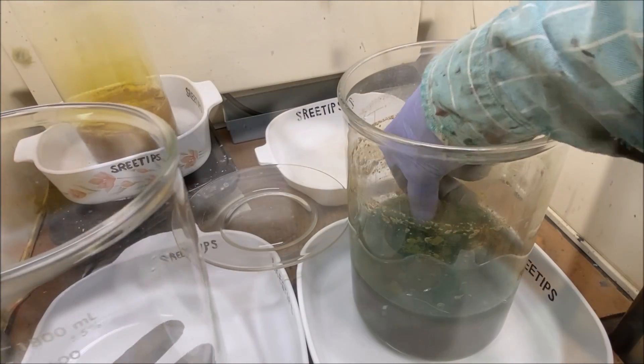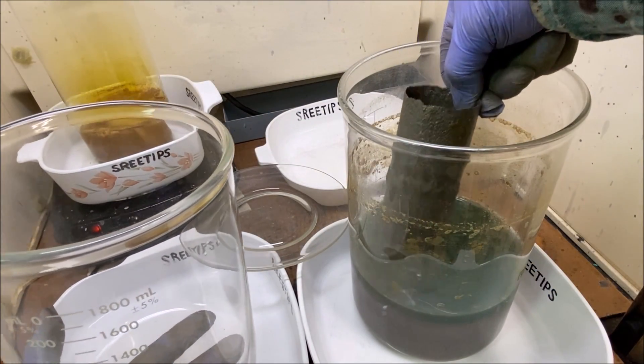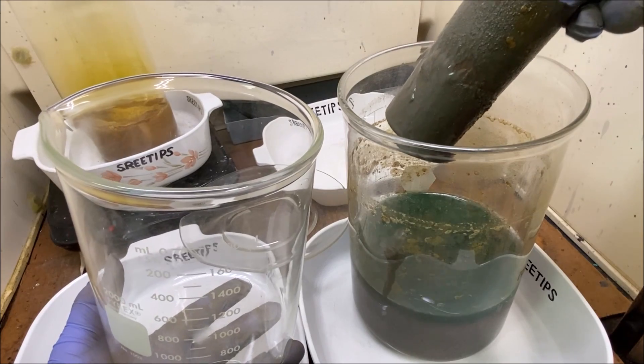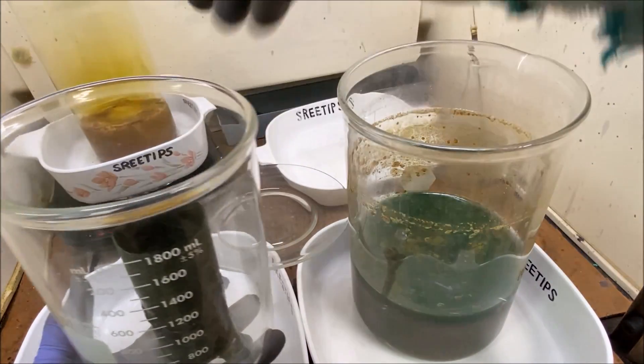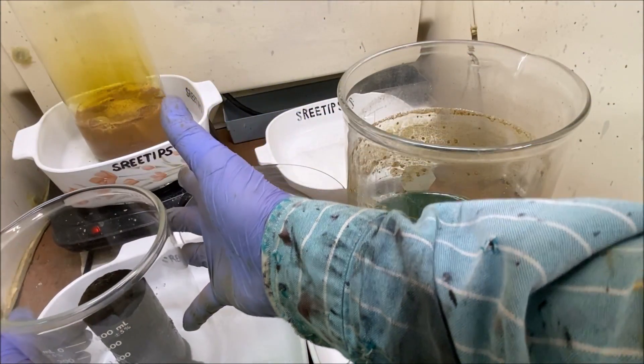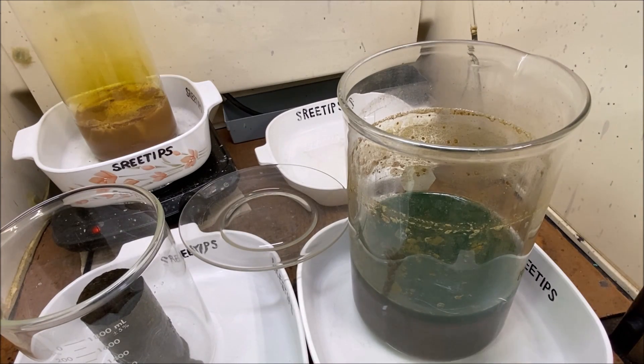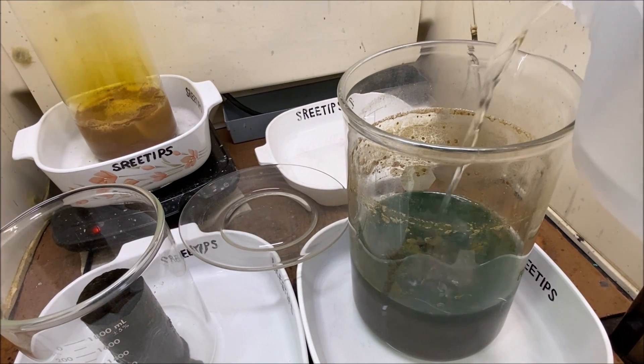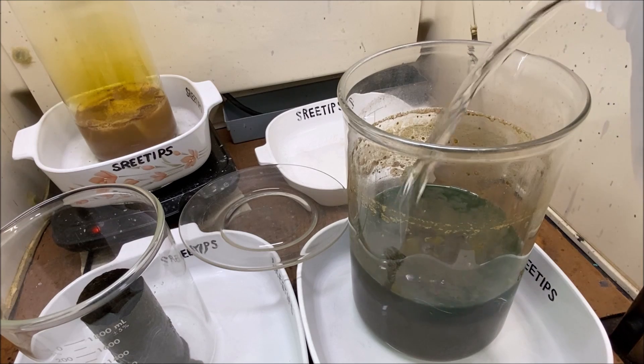Let's get this piece of copper out of here. It's still got some metallic copper left. I'll use it cementing out silver in another solution. But for right now what we'll do is just add some distilled water to this.